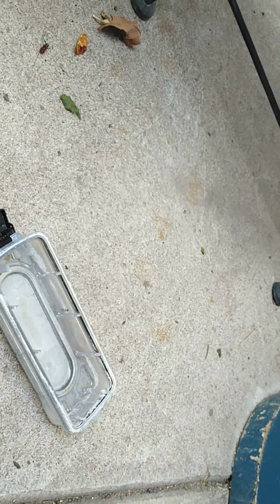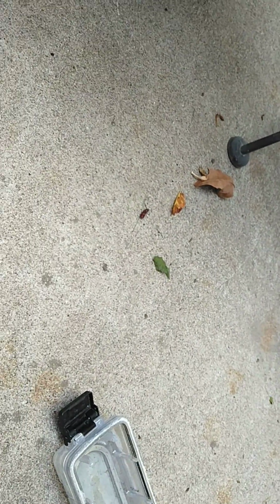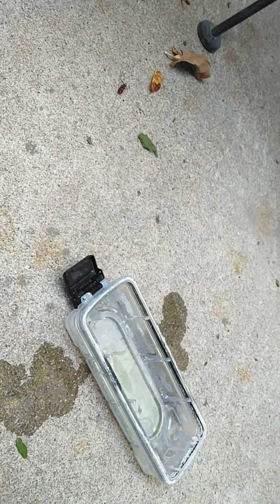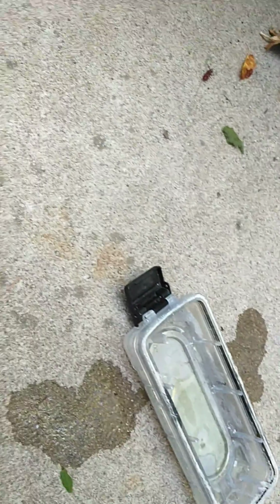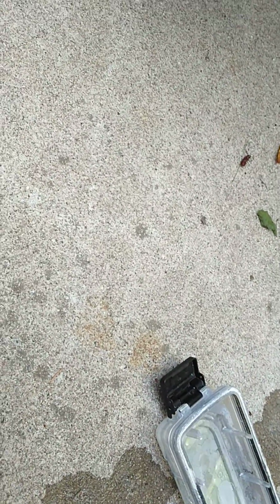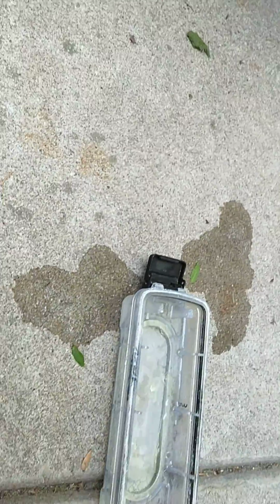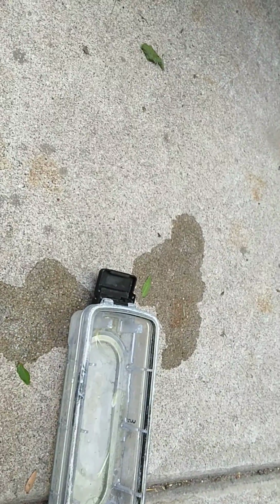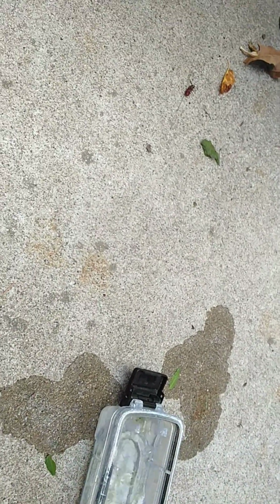Mixing in this old reservoir. Let's see. Cool, it forms a layer. See how it doesn't mix? Could be separating something. Oh, that's a very pungent odor. Oh, strong. Let's try it.